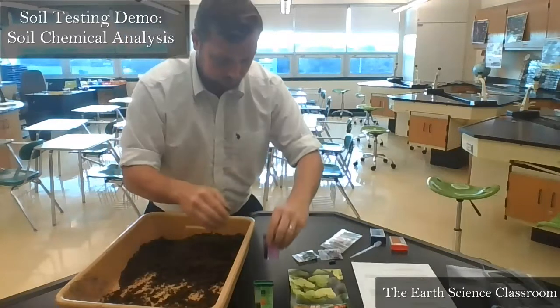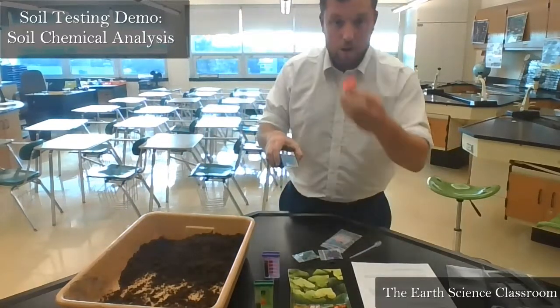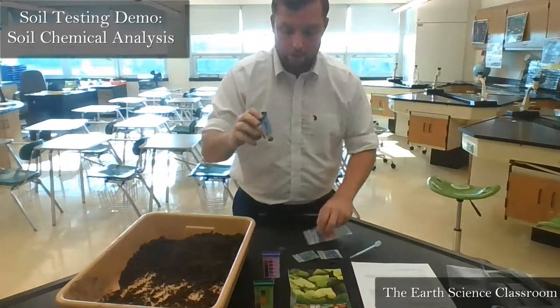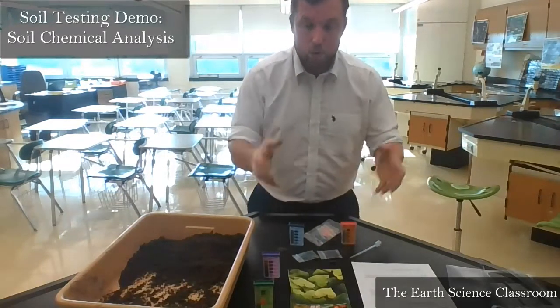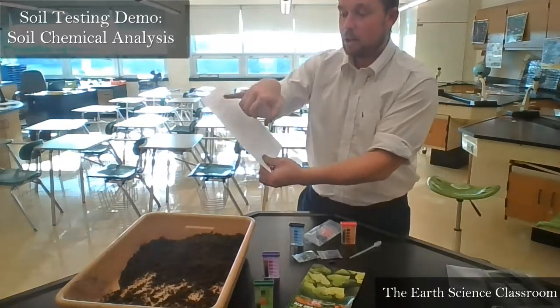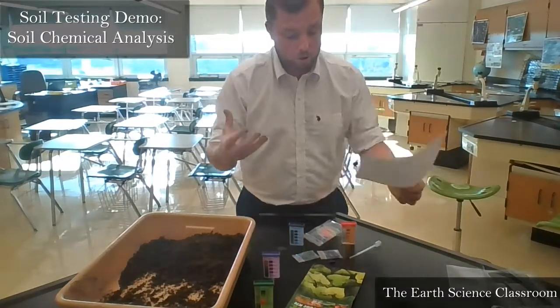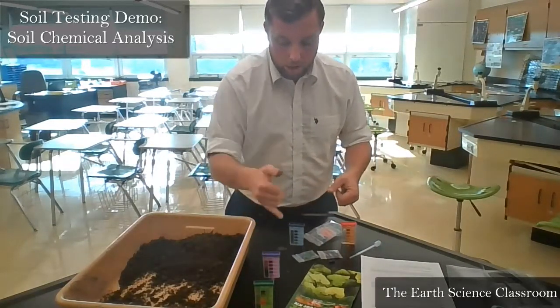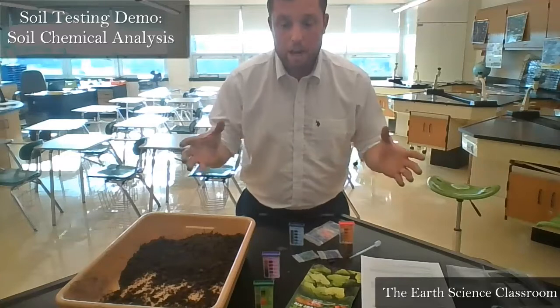right here. So guys, two more to do. You have phosphorus and you have potassium. Again, this is the blue capsules and the red capsule. Do the same procedure as with the other two, the previous two, and you write down your results on the sheet provided. Again, there's a little paragraph explaining to you what each chemical does and what nutrient does for the plants. And that's your chemical analysis. Make sure you have the pH, nitrogen, phosphorus, and potassium in your data, and you are good.